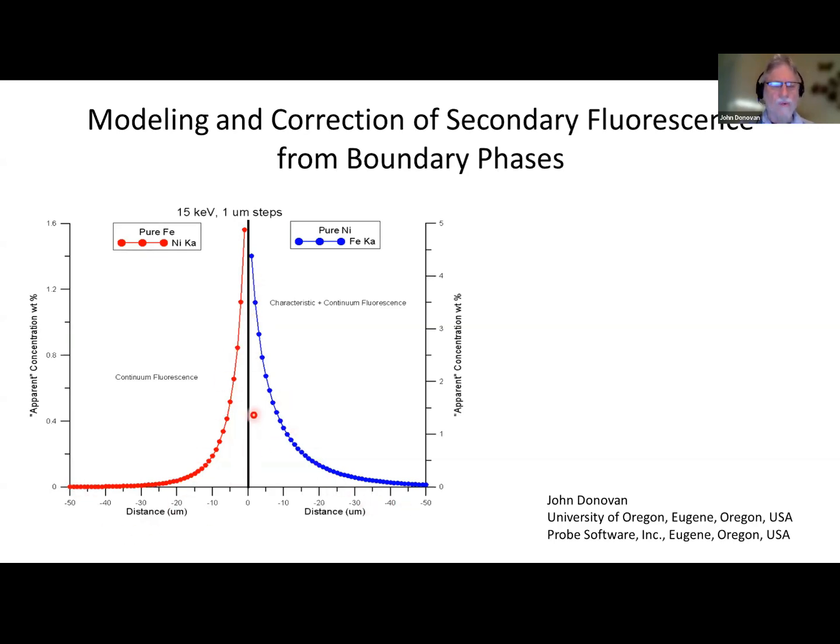What you're seeing here is that in almost all cases you have a continuum fluorescence that occurs. We're seeing a 1.6 weight% artifact. This is completely an artifact. It looks like a nice diffusion profile, doesn't it? But it's not. It's completely a fluorescence artifact. On this side, where we're measuring iron K alpha in pure nickel, we're actually getting over 4 weight% of an artifact. So this is something that needs to be thought about.